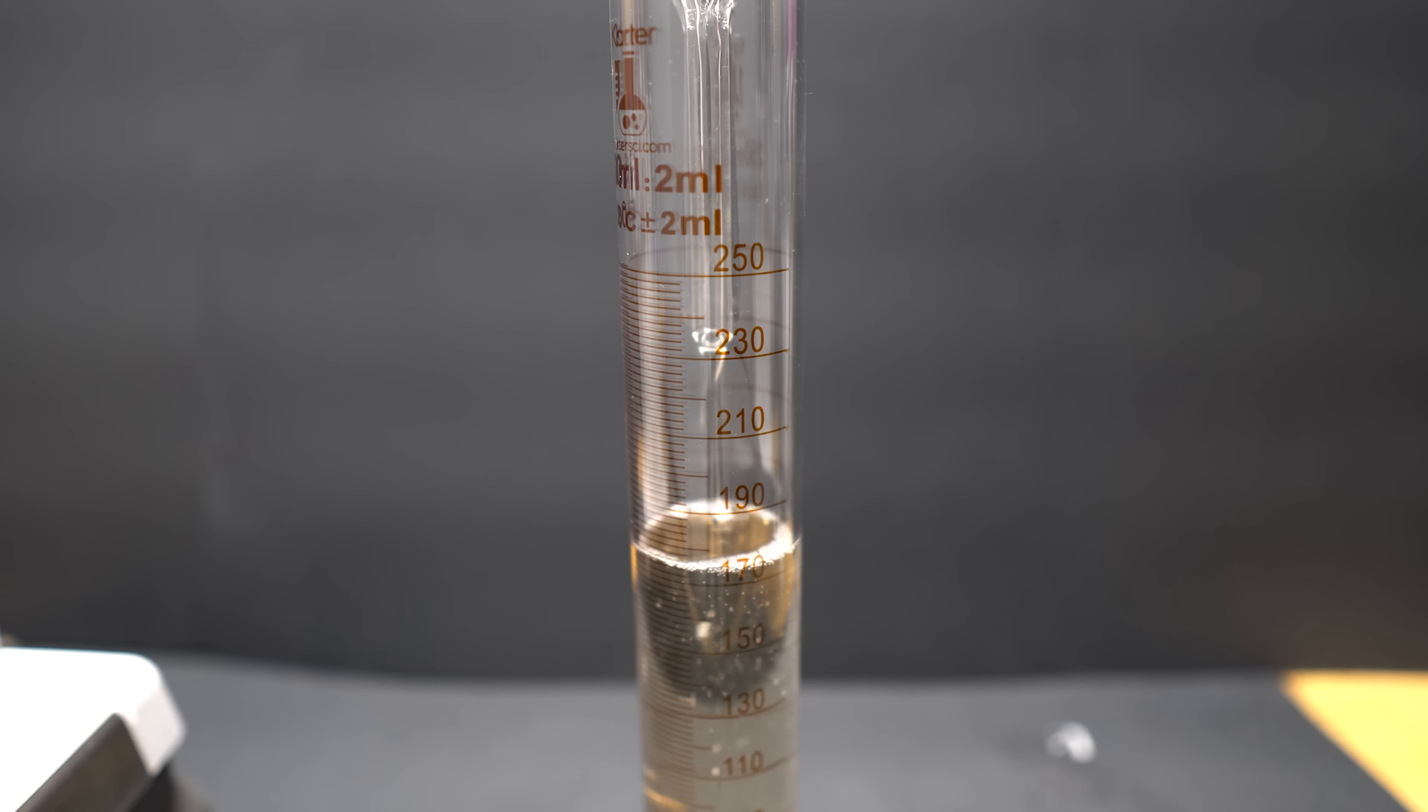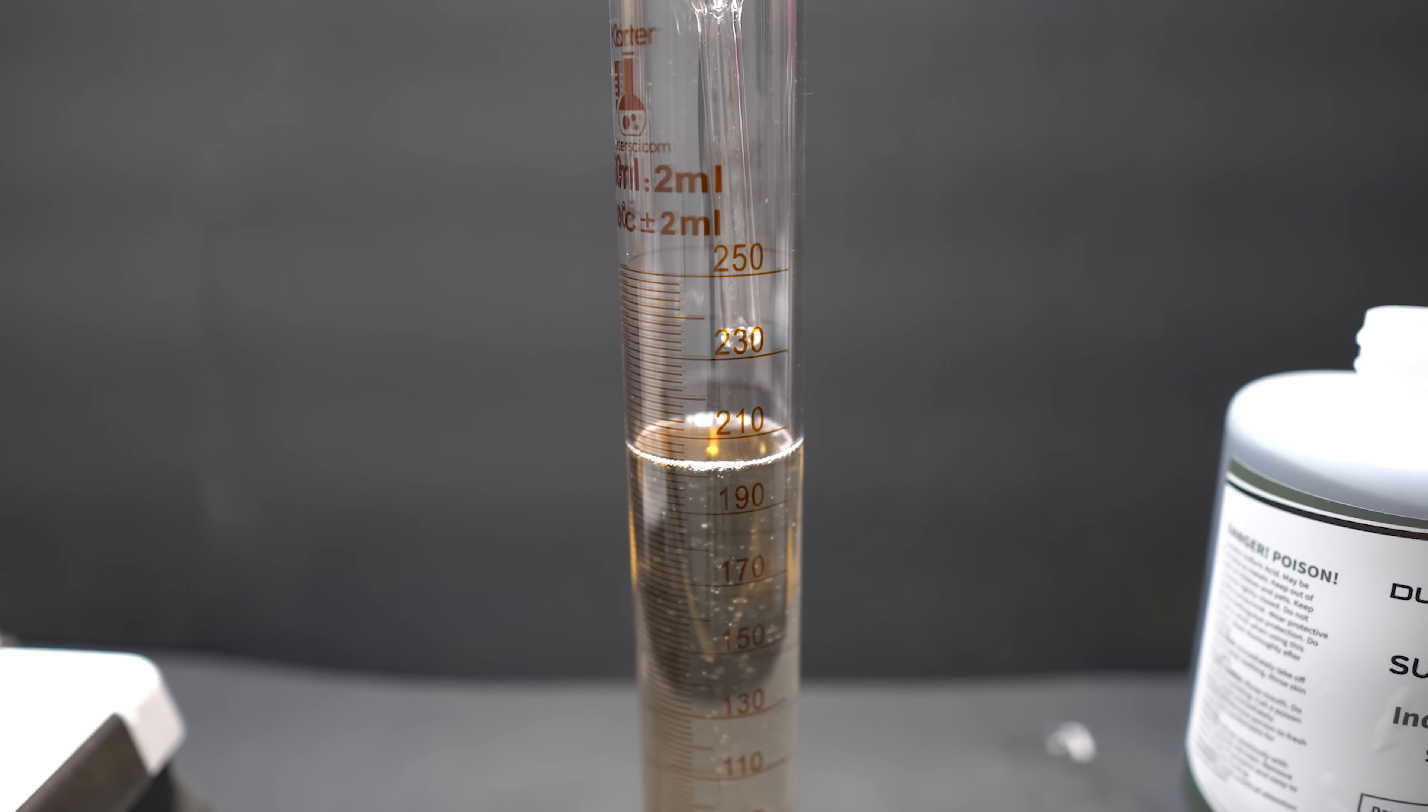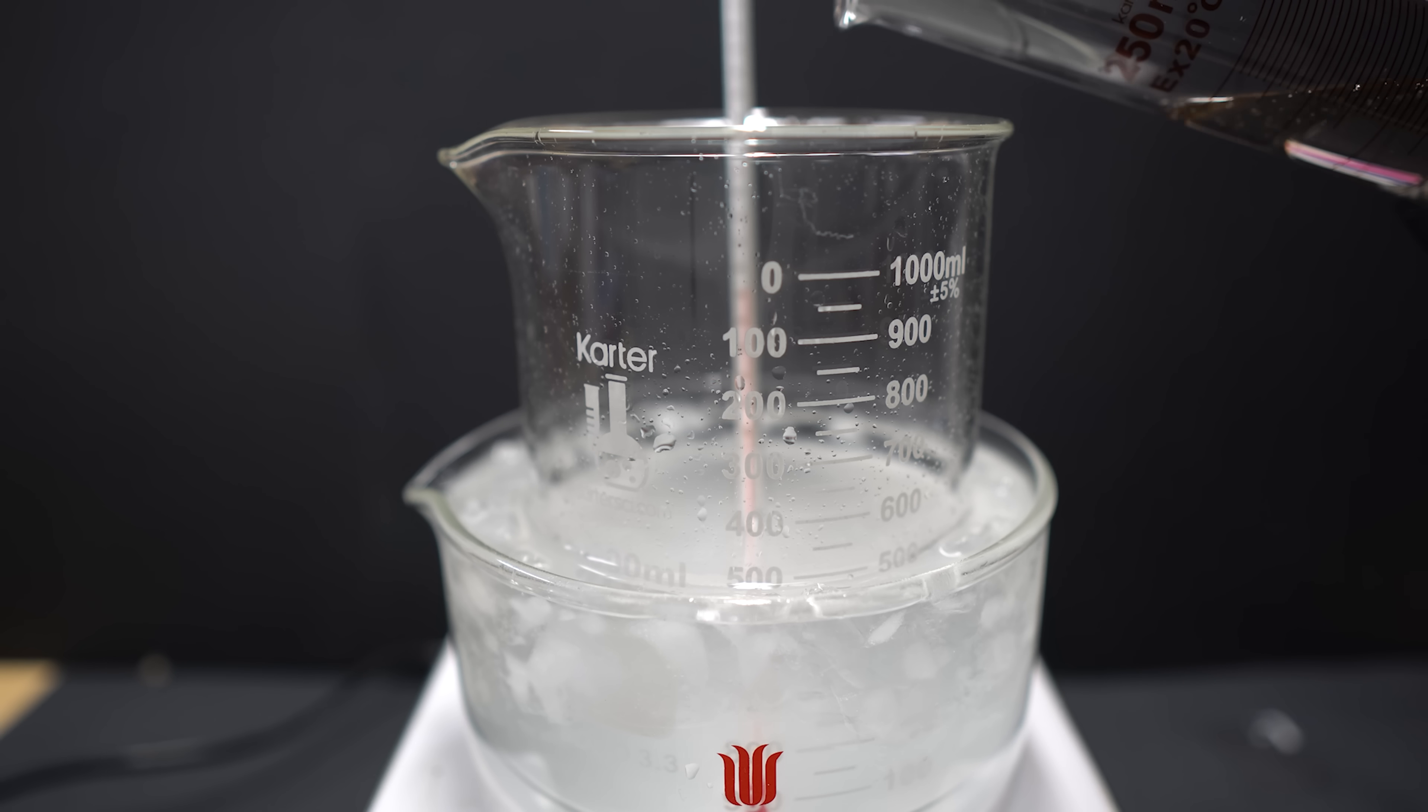My sulfuric acid does have a weird color to it. That is perfectly fine. Sulfuric acid does that once it's left in its container for a while. So if you do see that when you do have sulfuric acid, don't worry too much about it.